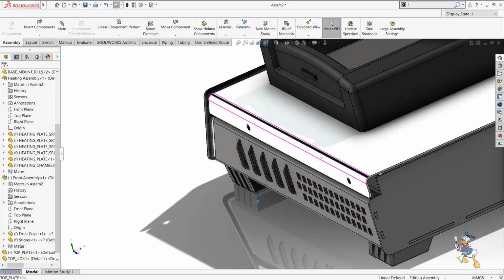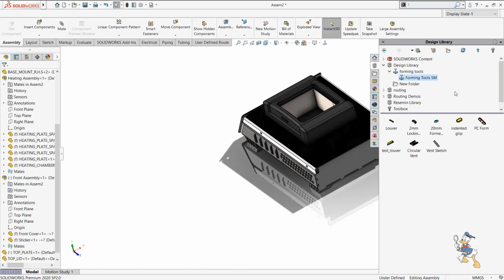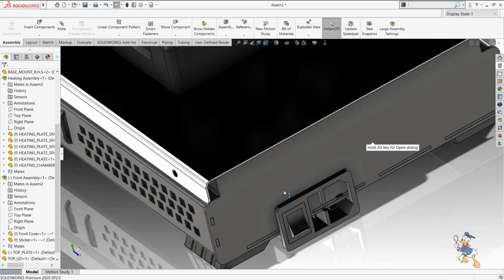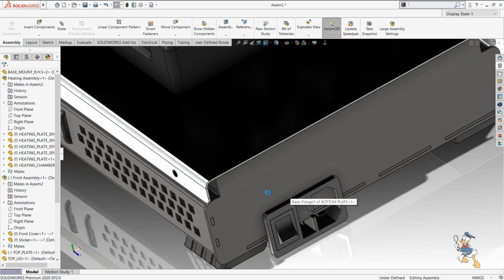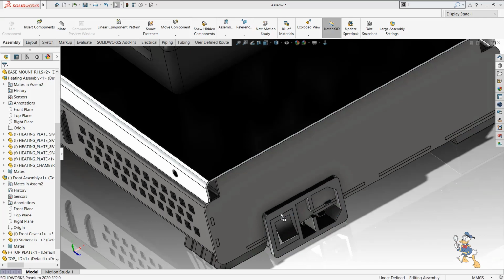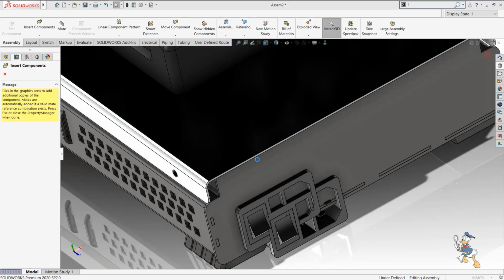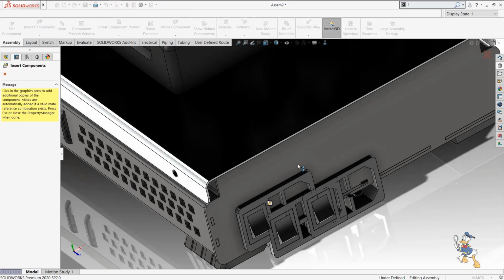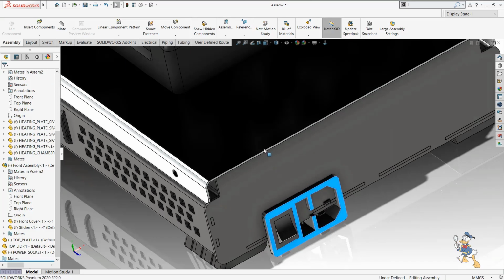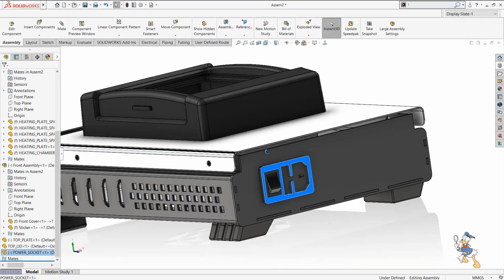Now I just need to place some sockets here. I just need to select that socket. I just need to drag it over here, and then it will make the feature very easy for me. This one replicates itself, so I just need to delete this one. I just need to place it over here.